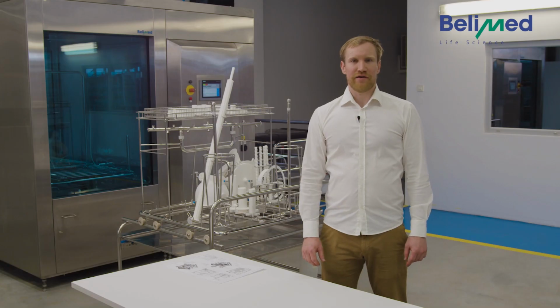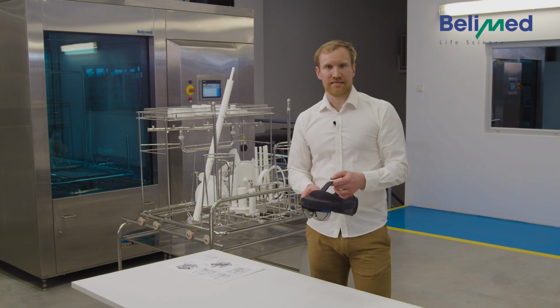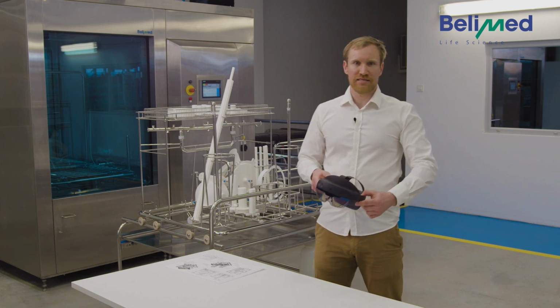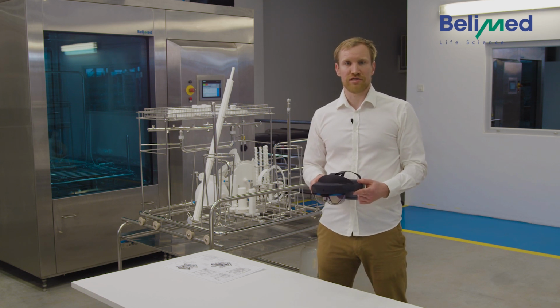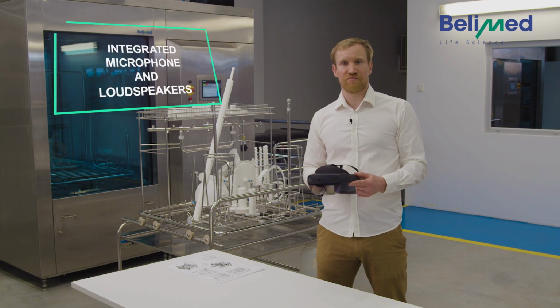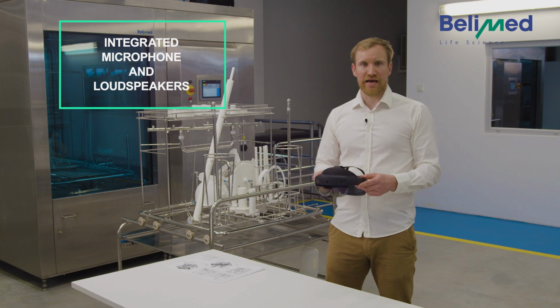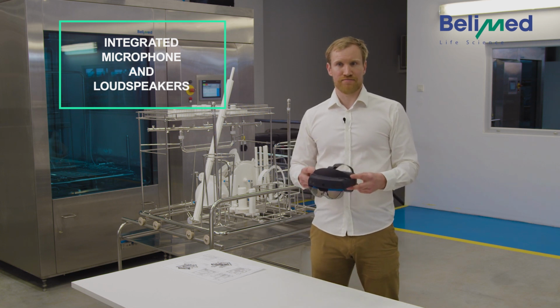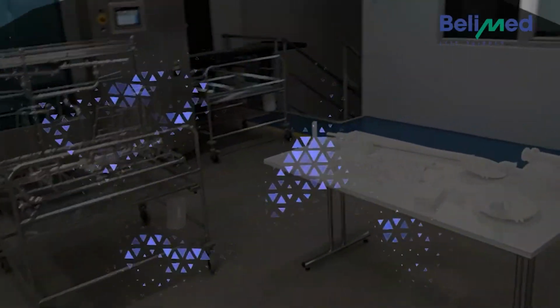For that, we have developed special software for mixed reality glasses. With these glasses, the loading of a rack can be done safer and more efficiently because they can give audio assistance and visual assistance. So let's reset the rack and I'm going to show you how it works. Please say start to start the program. Start.